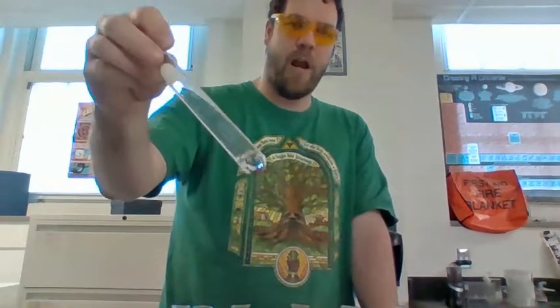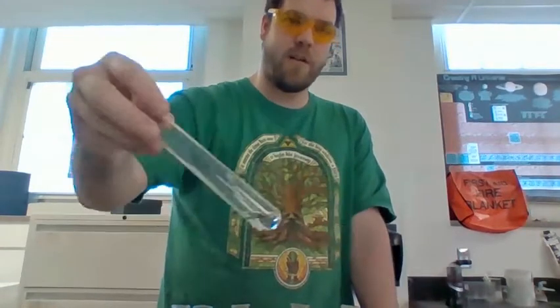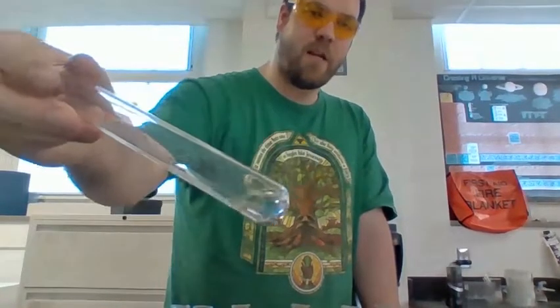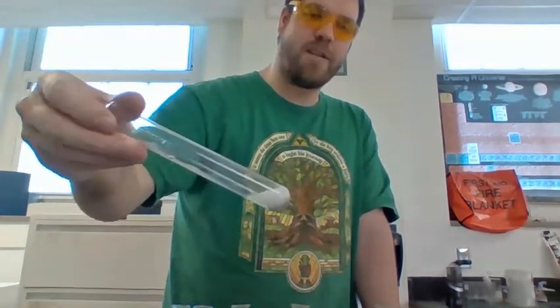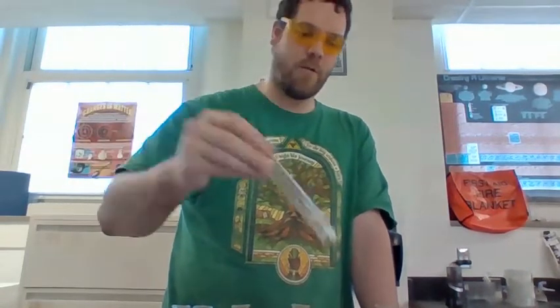Okay, but what does all this mean? Basically, what we're trying to find out is whether something changed the identity of the substance or whether it did not. Whenever we had something like the copper react with the water, it did not change the identity of the substance, and neither did its reaction with the acid. But our reaction with zinc with water did not change the substance, but our reaction with zinc and acid did. So then we would write zinc with acid is a chemical change. It is forever changed. It cannot go back to what it looked like originally.